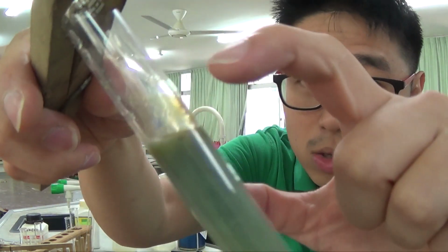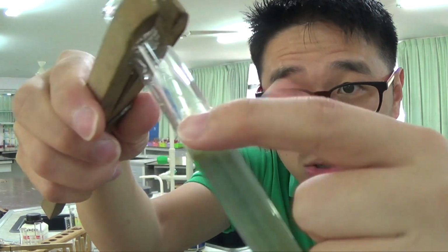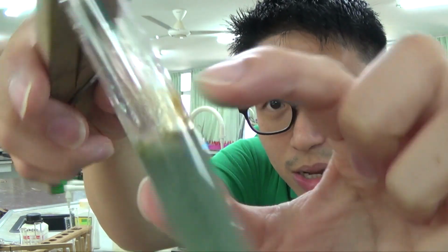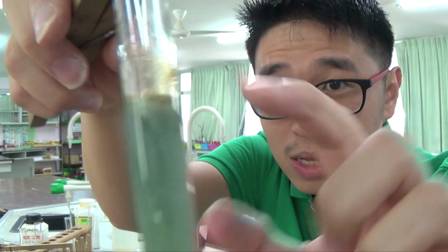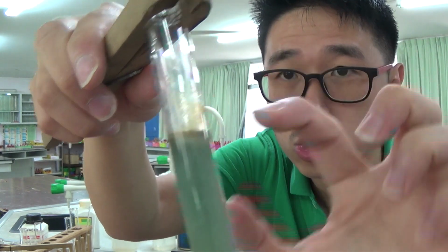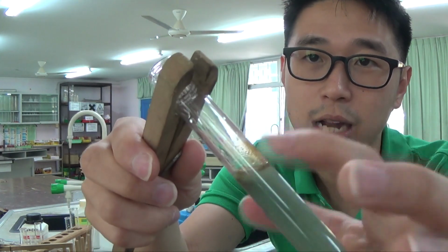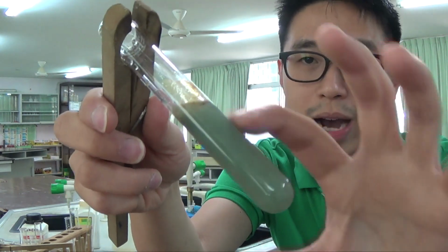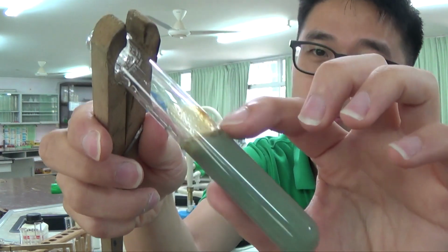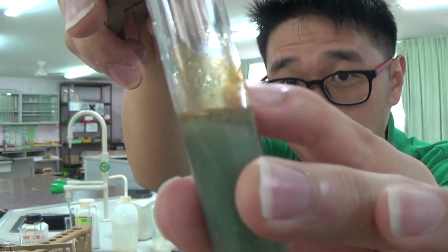So you can see the iron 2 has slowly turned brown on top there. It's very quick, yeah. Iron 2 hydroxide is very, very quickly oxidized. If I leave this standing for about 15 minutes, you will see it turning more and more brown. The brown color is iron 3 hydroxide, and you can smell it. It smells a little bit like rust, because rust is iron 3 oxide, and this is iron 3 hydroxide. The iron 2 hydroxide has been quite rapidly oxidized to iron 3+. I hope you can see the brown coloration on top.